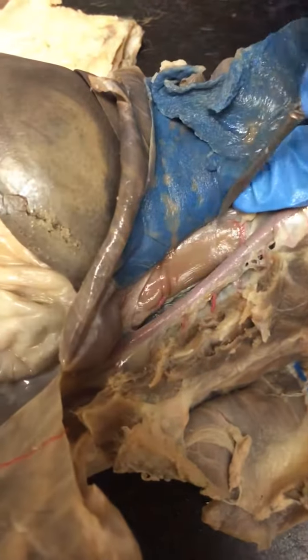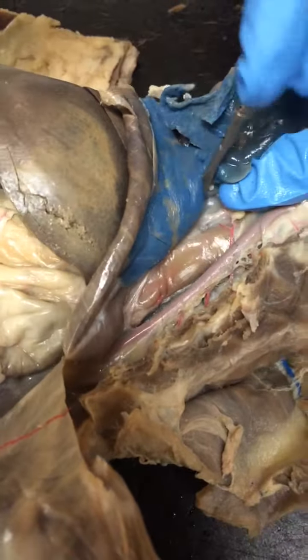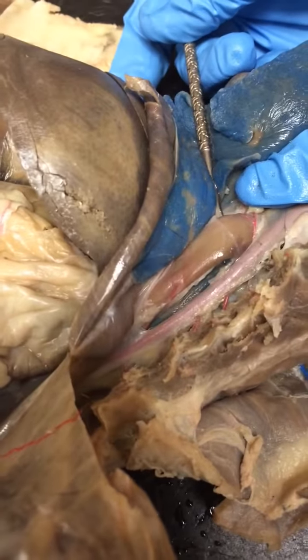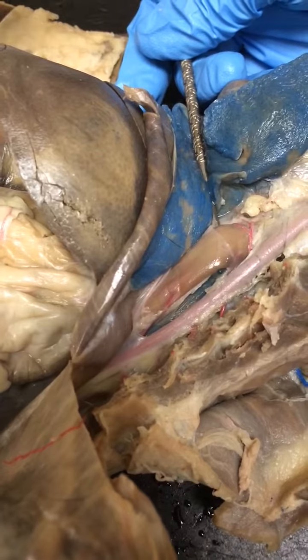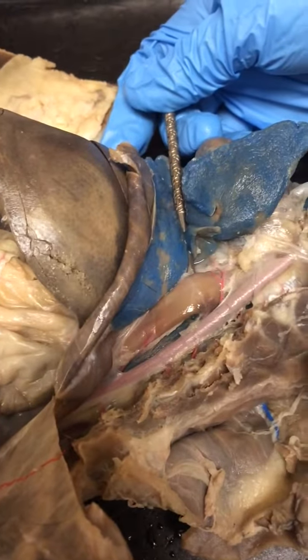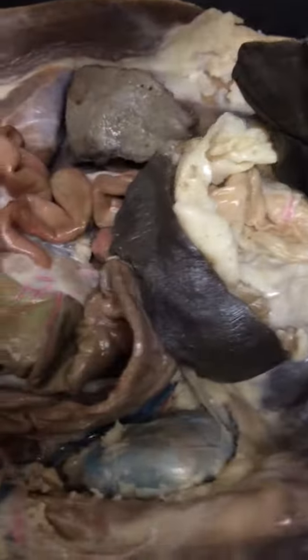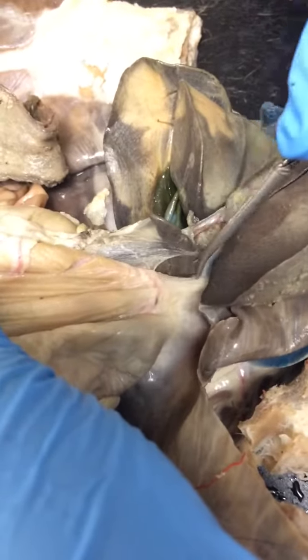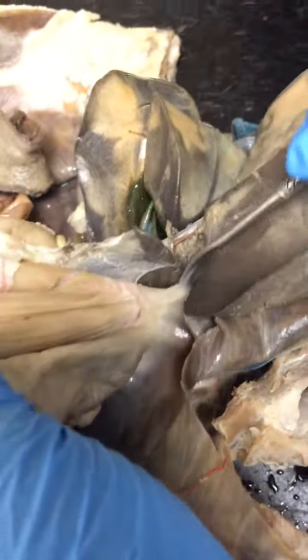Additionally, if we move all this over, you can actually see it right there. So if I move that and get in there, this is your esophagus right here. So you can see the esophagus in three places. You can see it here, underneath the trachea, here, below all the heart, lungs, all that stuff, right next to the dorsal aorta, which we can see in red right there. And then if we grab the stomach here and pull it down, we can see it in here. It kind of comes out, and it doesn't look very good on our cat, but it's in there.